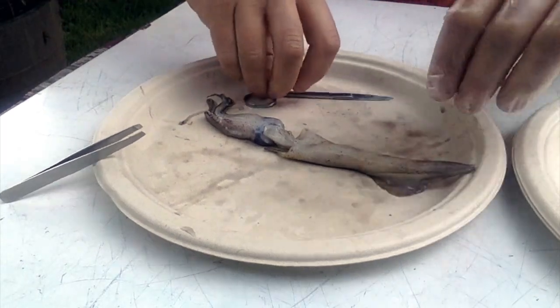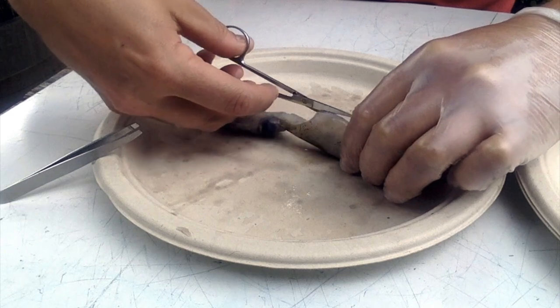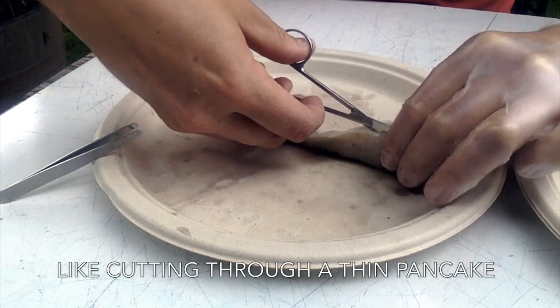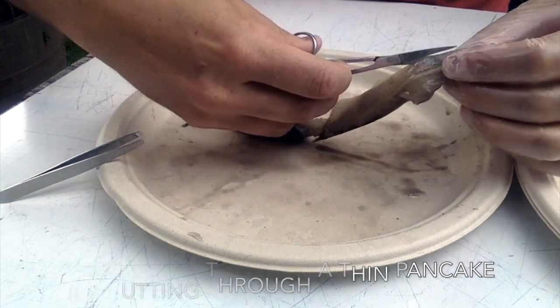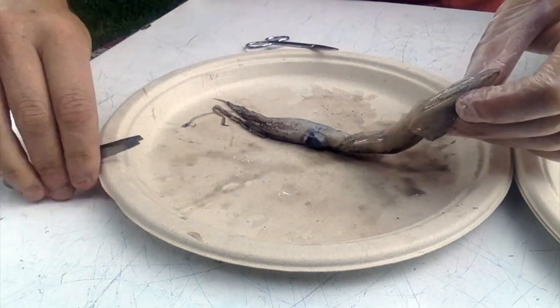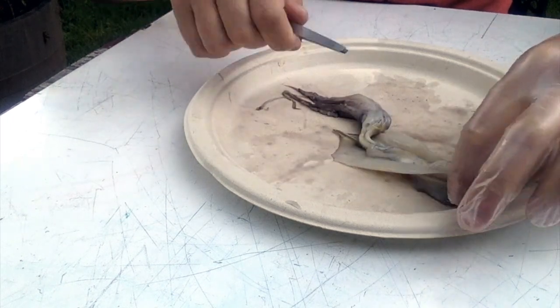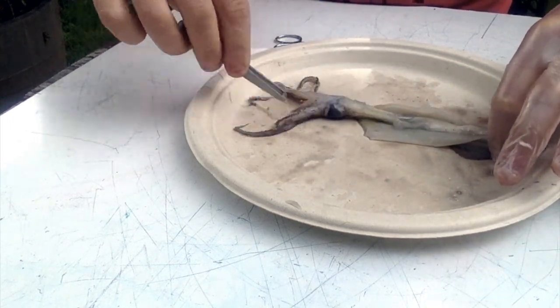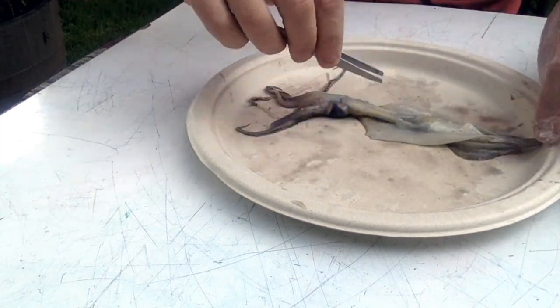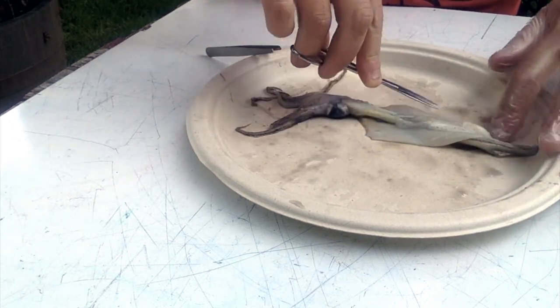And the first cut that I make is going to be right up along this section here. So I can open this up and take a look at the different internal structures. I like to splay them out because they look kind of cool that way. It's really simple to cut through. It's not a very rigid structure at all.